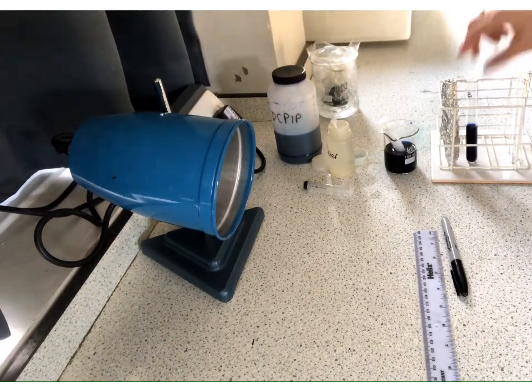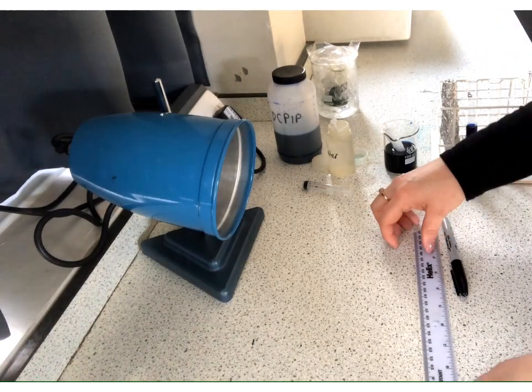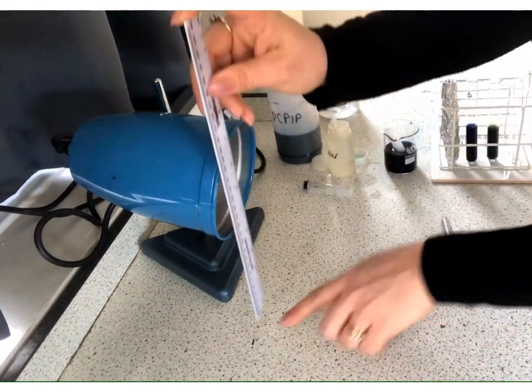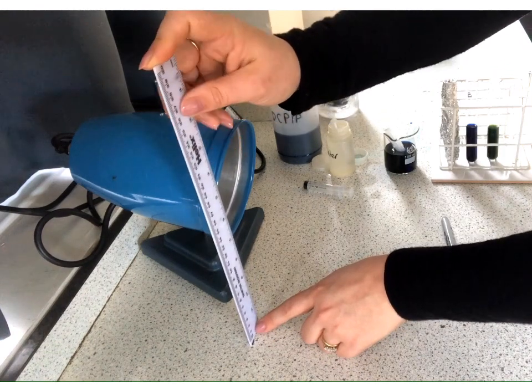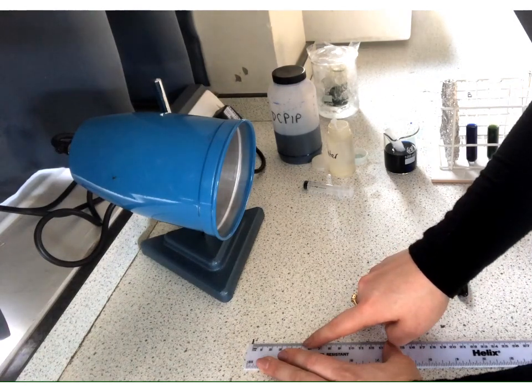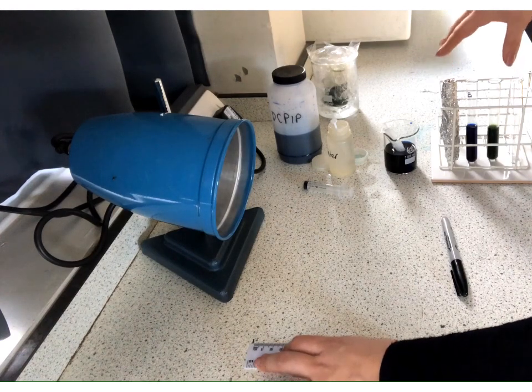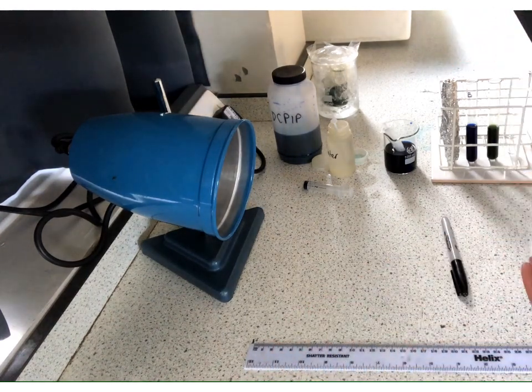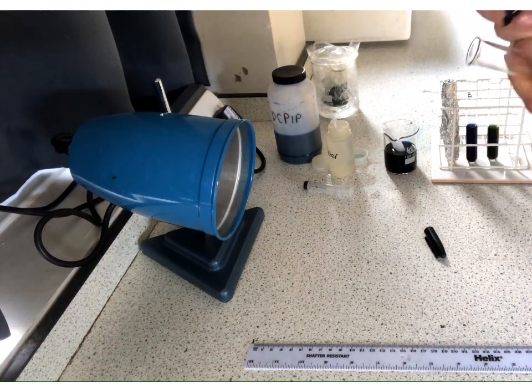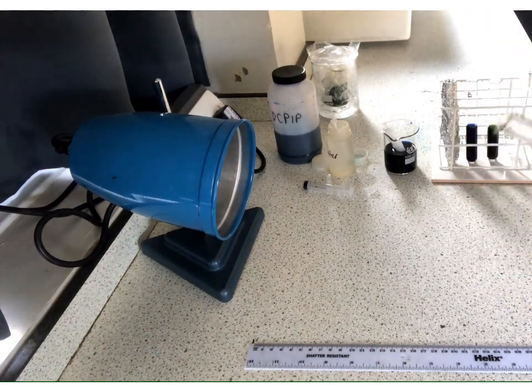Okay, so now what we can do is actually start to investigate the effect of the light intensity. So what we've got here is a desk lamp and a ruler. So what I've done is I've made a mark on the desk using a marker for 0, and then we are going to run our first investigation at 5 centimetres away, so distance. So we're going to set up the rack at that distance away. Okay, so we'll do them one at a time. So this is going to be our first one. So we're going to label the tube X, and I'm going to also write 5 centimetres on it so that I know that that is the correct tube.